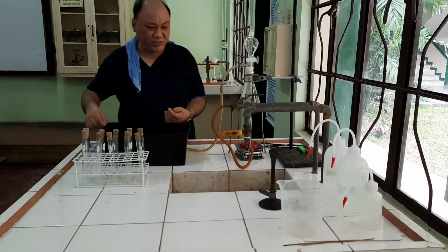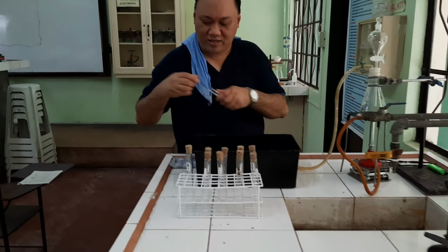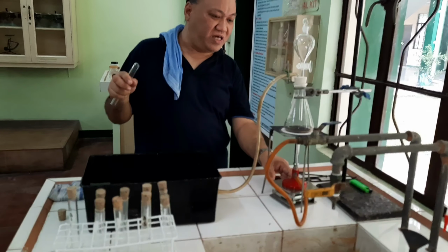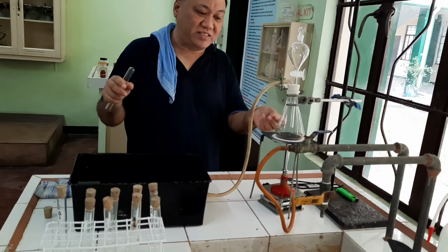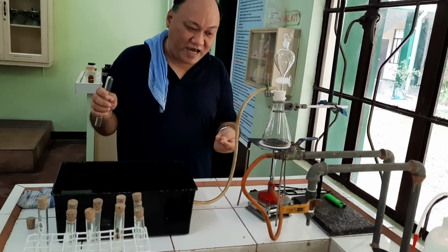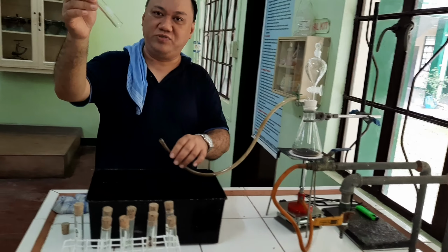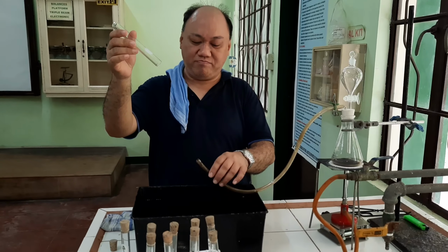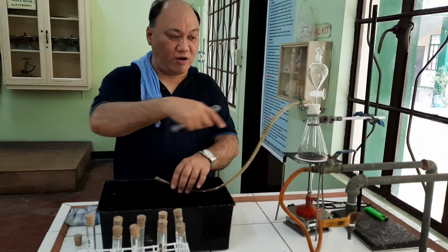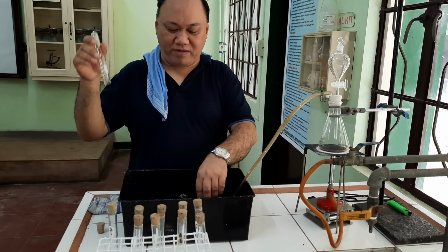As I have explained earlier, later on, as the reaction proceeds, as this mixture melts and eventually boils, it will evolve gas, and we expect that would be oxygen. So we collect oxygen using the water displacement method. Oxygen will flow through this rubber tubing here. Then we will collect that through water displacement by doing this.